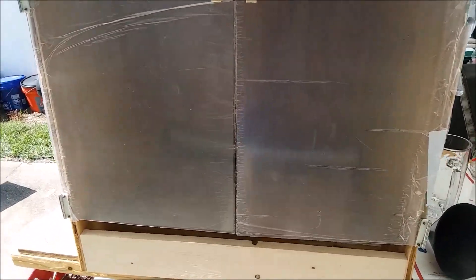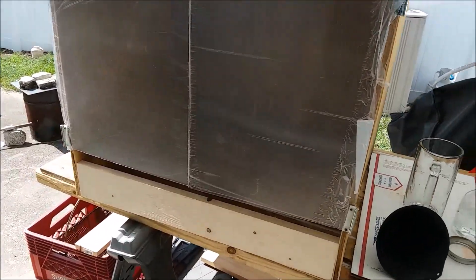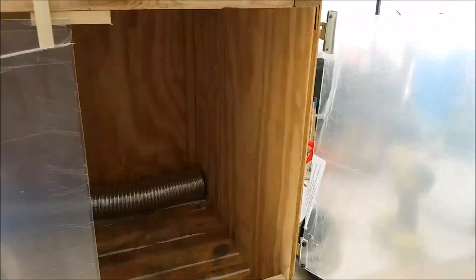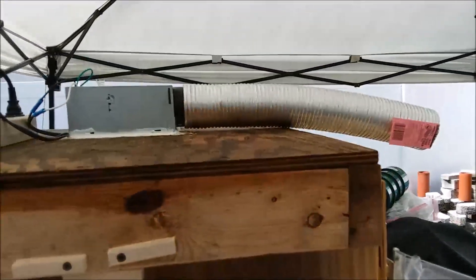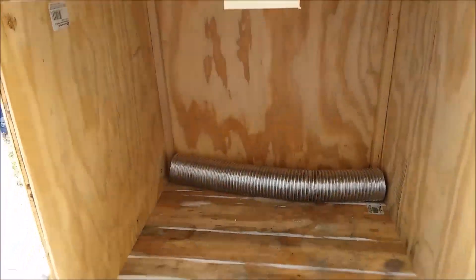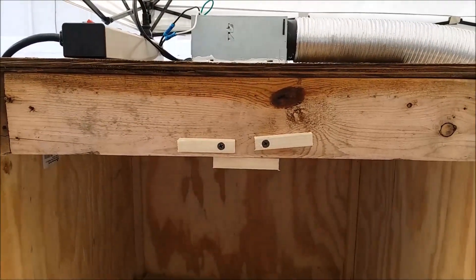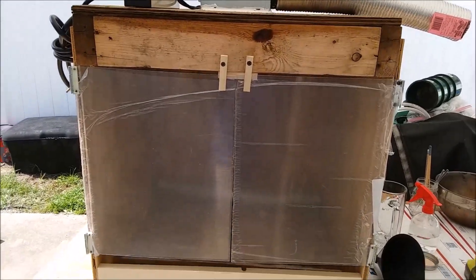Major progress on my homemade fume hood — I got doors on it. I was down at my local Ace Hardware and found out they'll cut plexiglass to size; it's only about five bucks a sheet. So I got a couple sheets cut, got a few hinges, and made some little latches — now I have doors. I also found some flexible aluminum duct work, two eight-foot sections. The fan is wired in and runs. I've got LED strip lighting on order to go inside, and this thing is almost done.